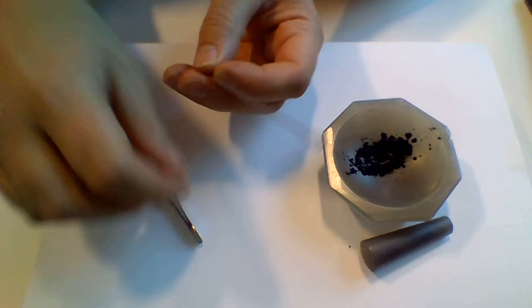Now I have the capillary relatively full at the bottom here, so that's perfect. I can mount this and then perform a measurement.